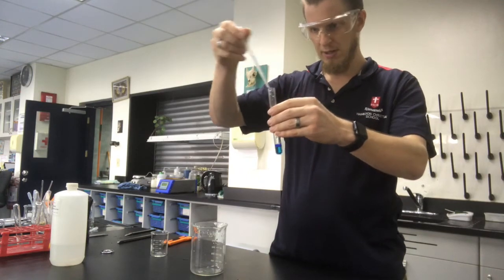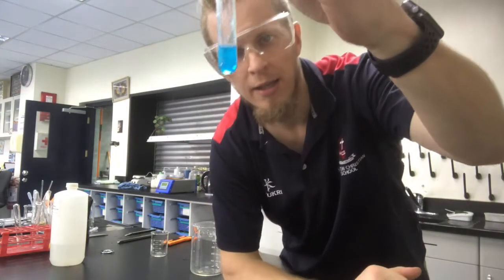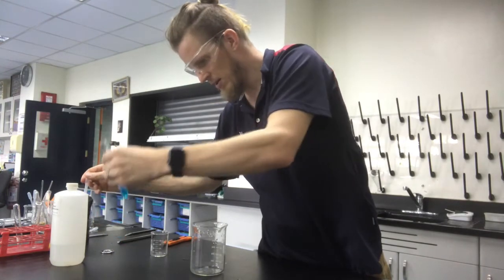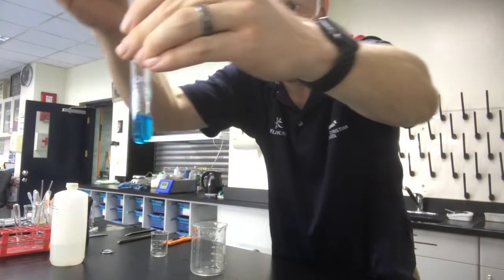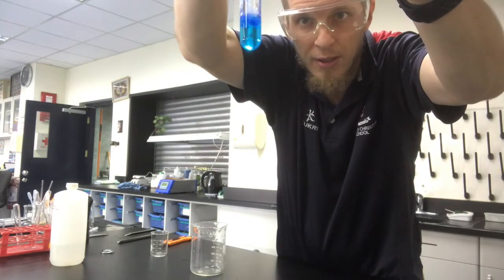Okay, so I'm going to put that in there. Right, and what you'll see is I kind of missed it. Let me just put another drop in there. Okay, I get a bit of a precipitate going on there. Might be a little bit hard to see. I've just got to do this a little bit at a time.